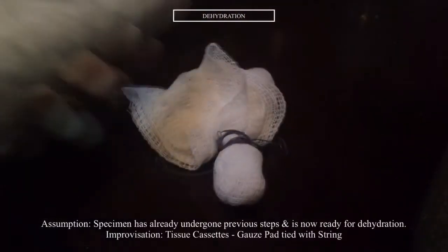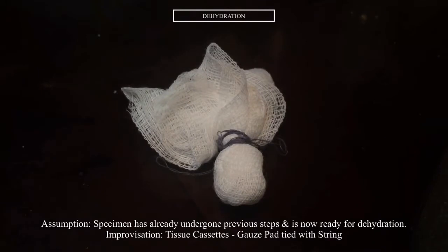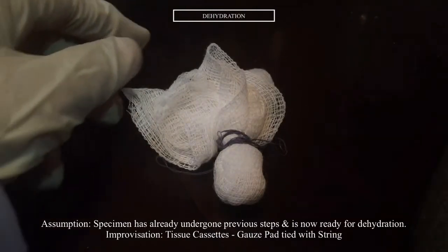So let us assume that this tissue has already been processed under the previous step, and this is what I received and is now ready for the dehydration step. Also, the tissue was wrapped in a gauze pad and tied by a thread since there are no tissue cassettes available.